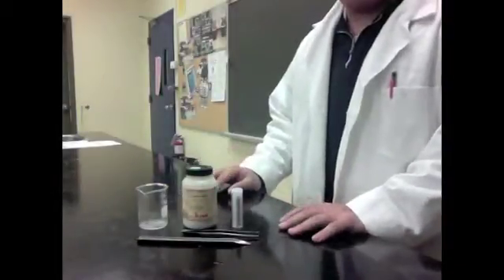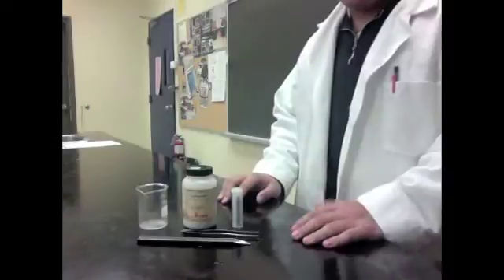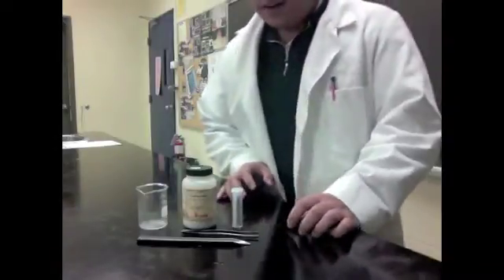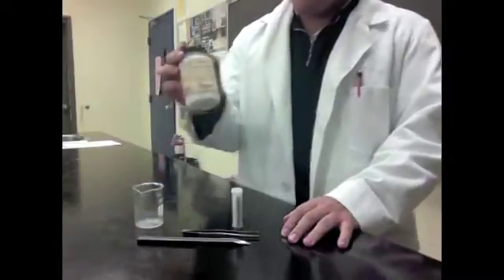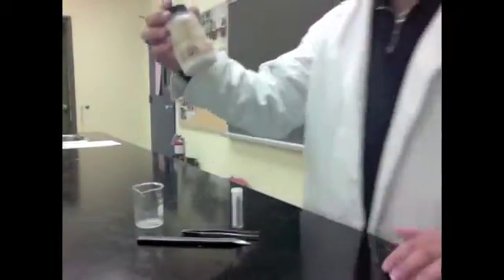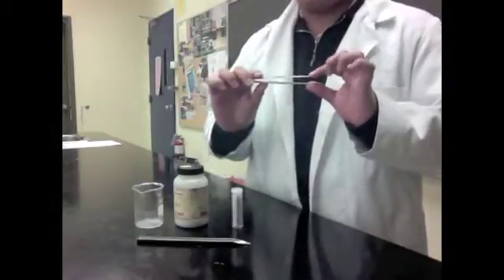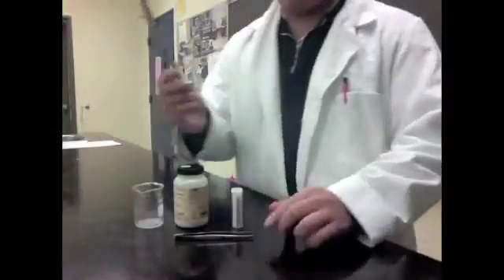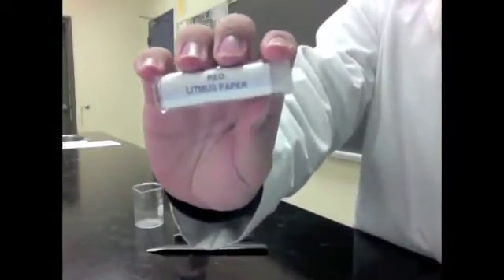So as I said before, our station is known as the calcium and water station. I'll just be telling you what the ingredients are for using in our station and I will show you how we're going to go through this experiment. So first, as you can see, I have a small beaker, a regular glass beaker. Secondly, we have calcium metal, a regular metal down in your periodic table. Third, we have our tweezers. We will be using this for extracting a very important indicator. Fourth, we have our spatula where we put our thumb here to extract the calcium from our bottle and placing it into our beaker. And lastly, we have our red litmus paper. Now this is very important in class because I want you to note what actually red litmus paper does. So keep that in mind.